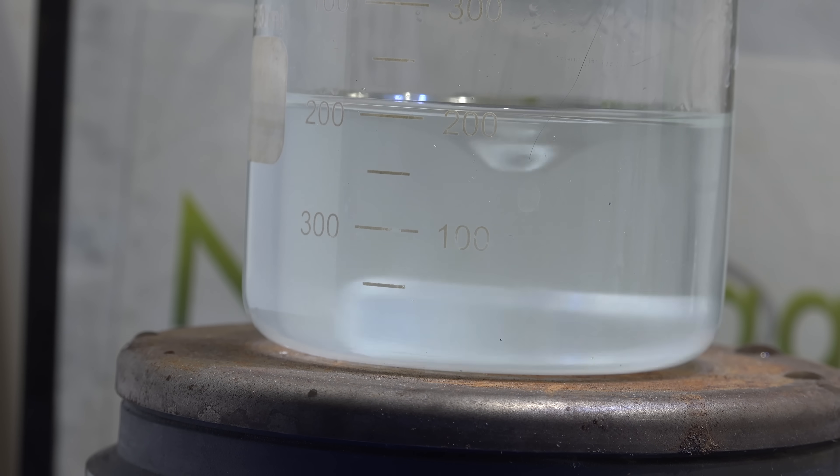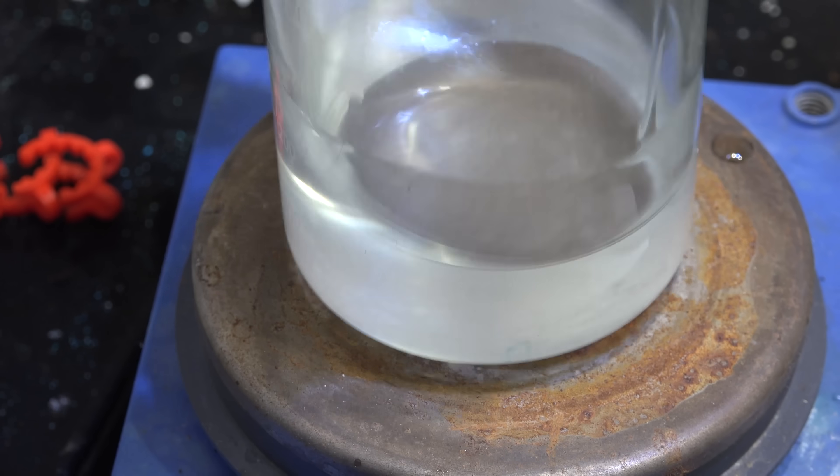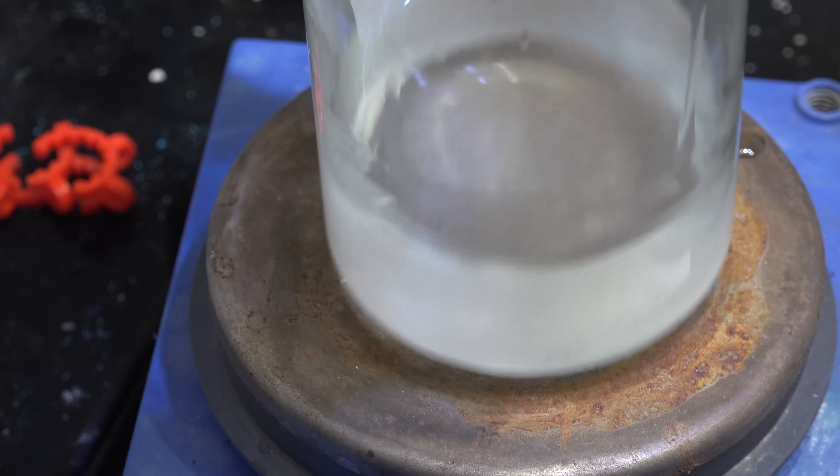Now you might be wondering if you can dry it and get sodium silicate crystals. You can, but I don't think it's worth it. This syrup doesn't seem to evaporate.